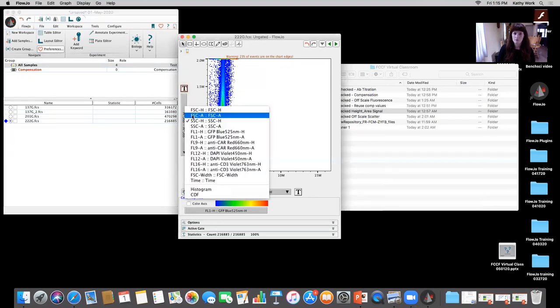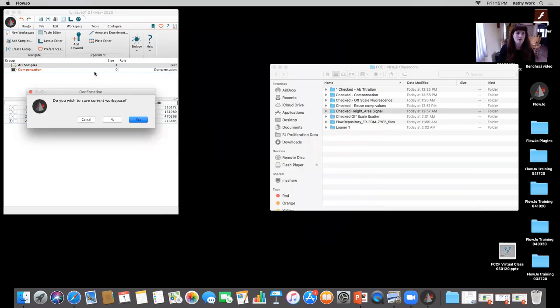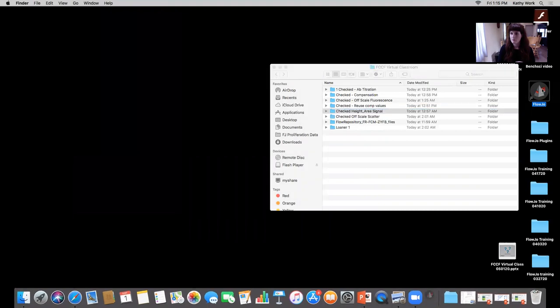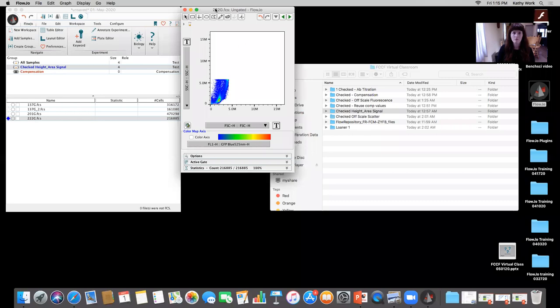Okay, now just because I change that, if I switch the detector over to side scatter area or anything like that, it's not automatically going to populate. So what I have to do is close it out. I have to close the workspace, and I'm not even going to bother saving it because I didn't really do anything. I'm going to quit out and open again. You do have to restart FlowJo when you make any of these changes, so just keep that in mind. And it takes 2 seconds, so it's just a nice quick little thing to show everybody. Drag that back in. Now when I go back in here, beautiful.